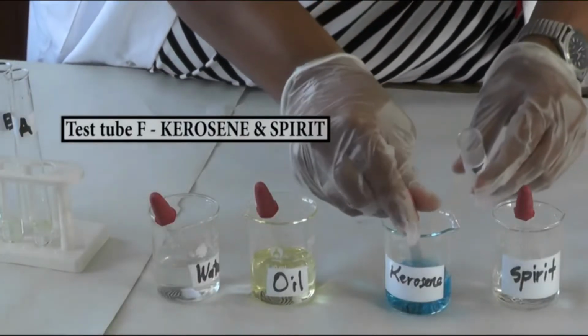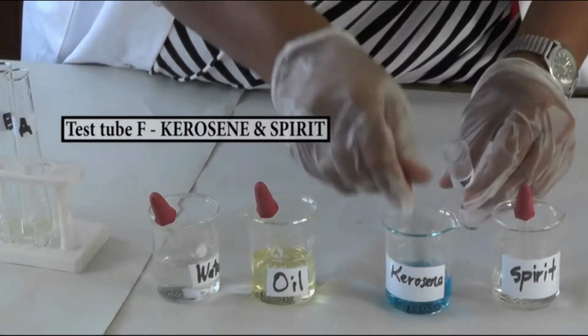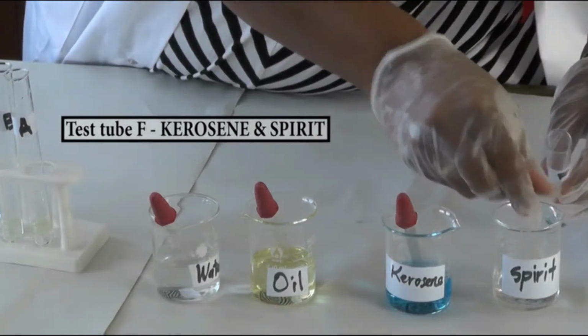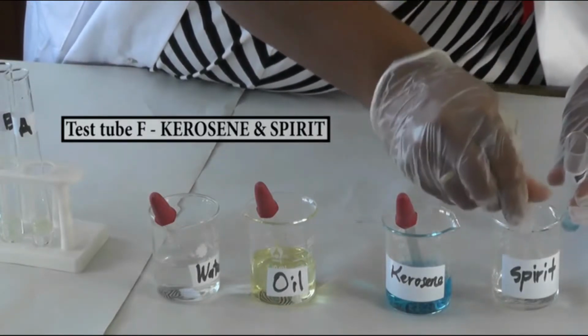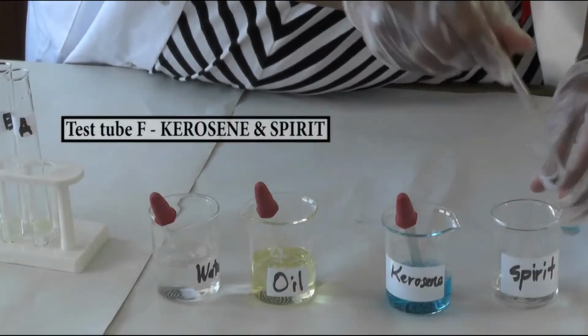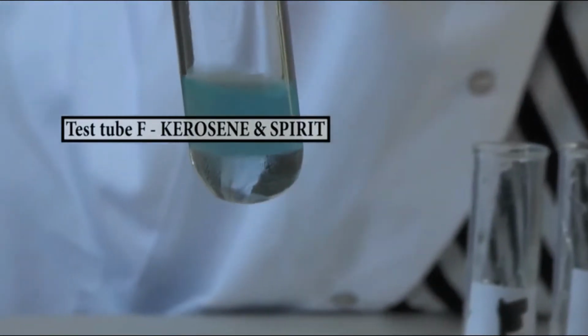And in test tube F, add kerosene with methylated spirit. Shake the test tube and then put the test tube back on the rack.